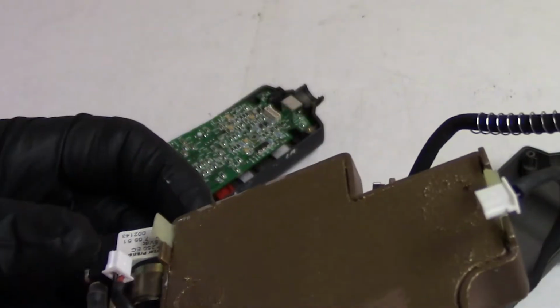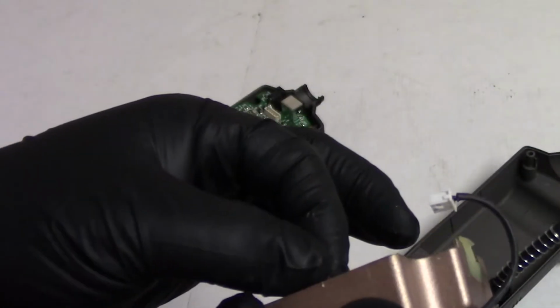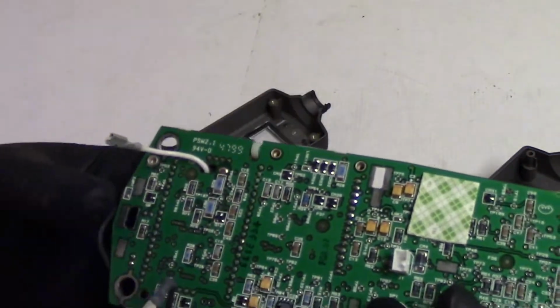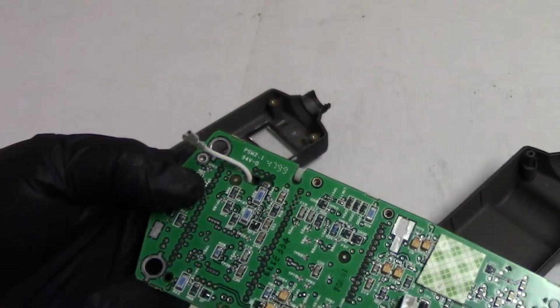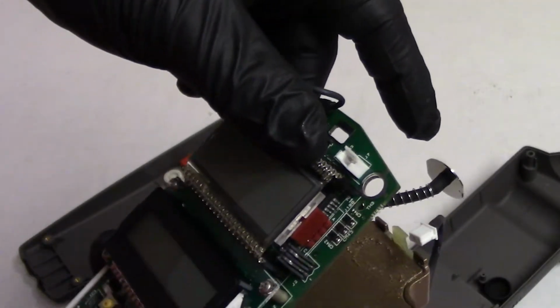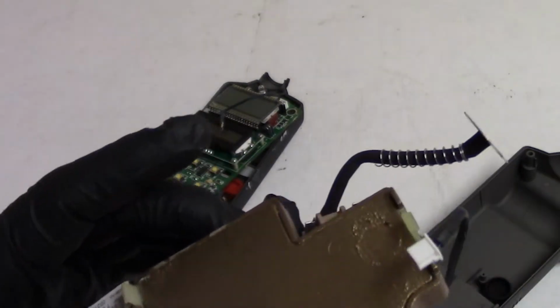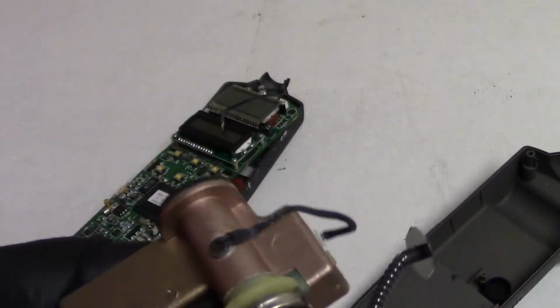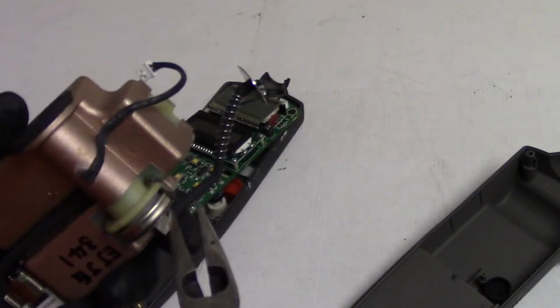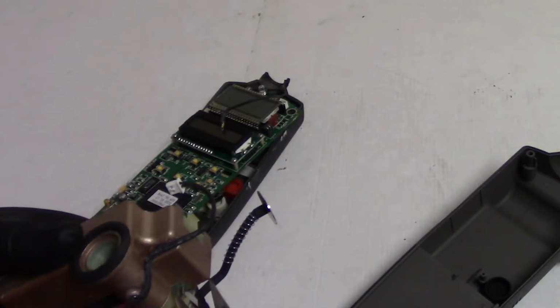I see these 2 pins here. They go into something. That might be for turning on the UV tube. I'll bet that has something to do with it. Let's actually look at that connection on the board here. Those plug into there, like that. It just says J2. It doesn't tell us anything about it. Maybe we'll put a meter on it when we fire it up. Let's see, can I get a better view? If I pop this clip off, can we see the detection grid?